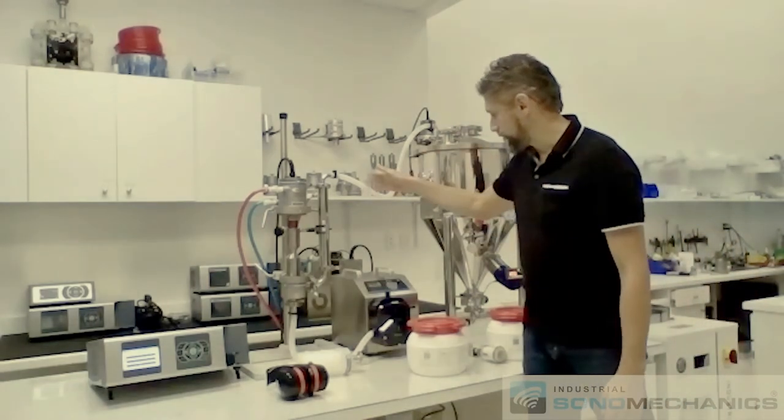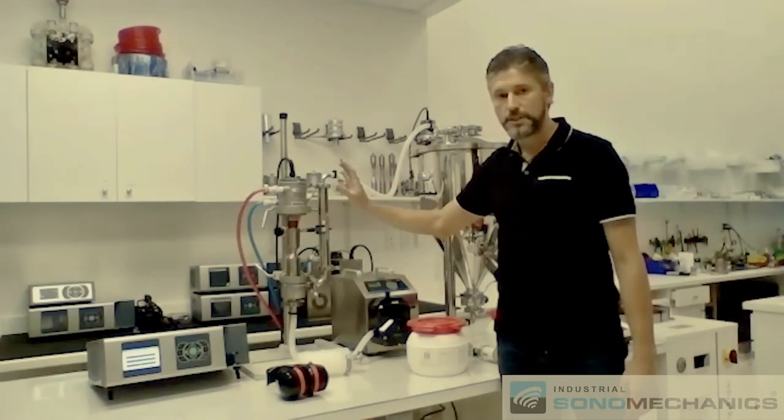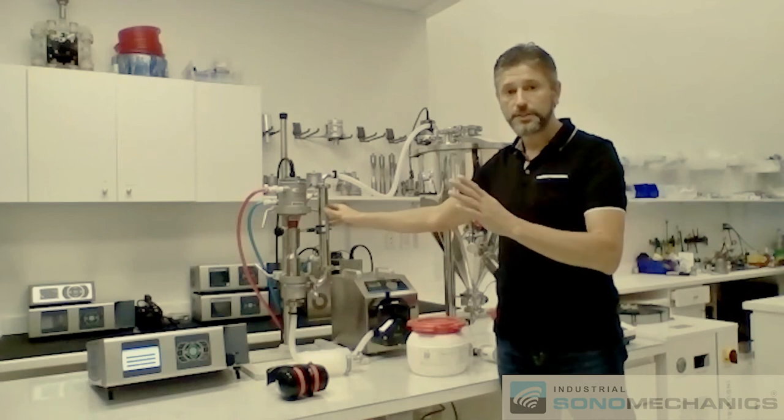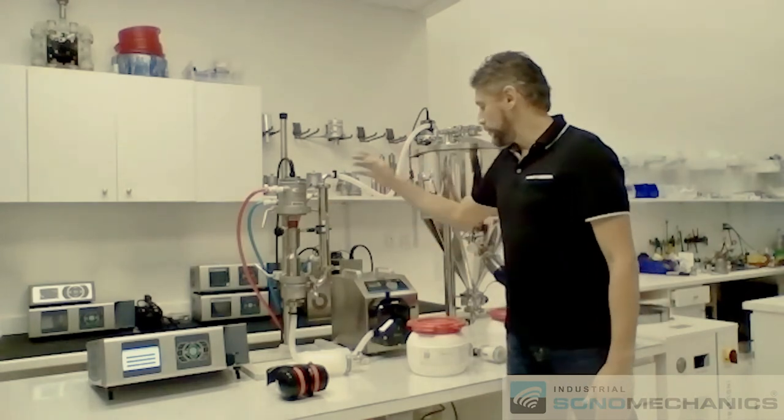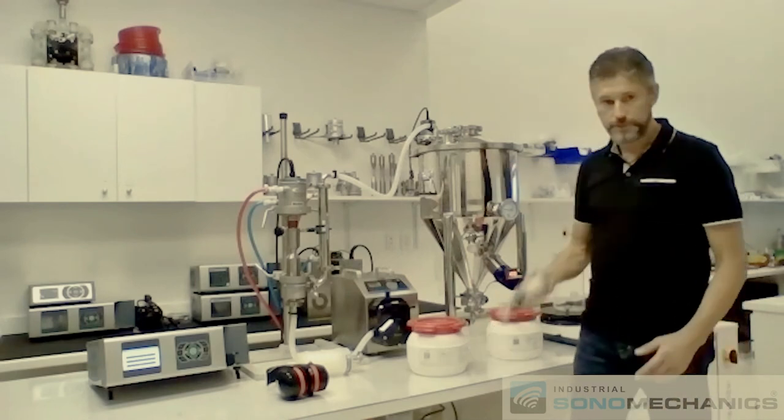After that, again, you purge all the lines. The same story applies to the temperature. You need to maintain temperature between 40 and 60 degrees Celsius. You purge all the lines, you collect everything in here, and then you use a different filter, this one. So again, you disconnect this, connect this filter.